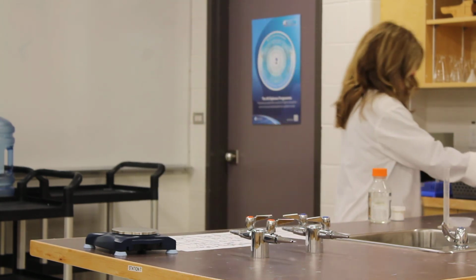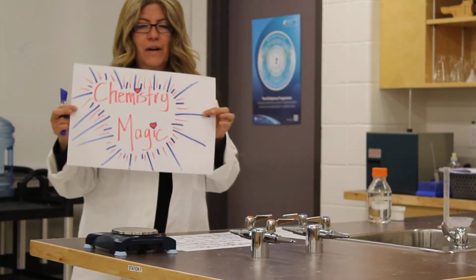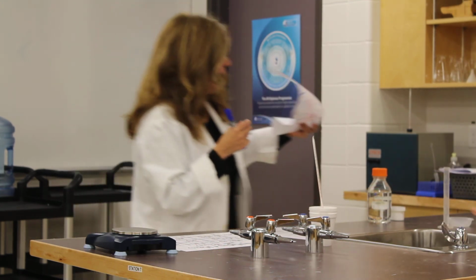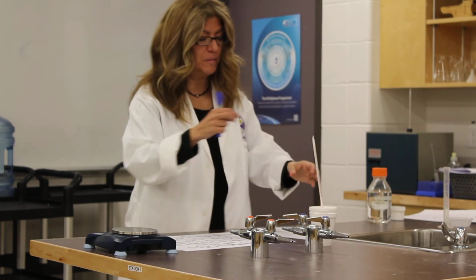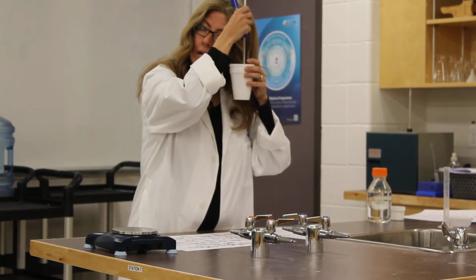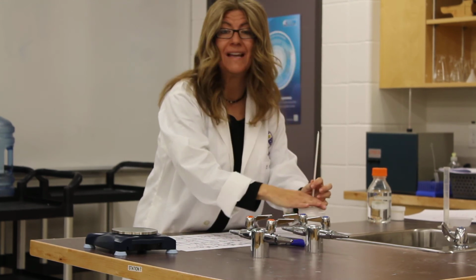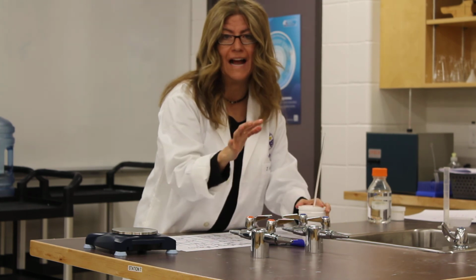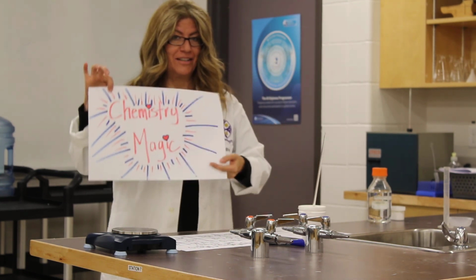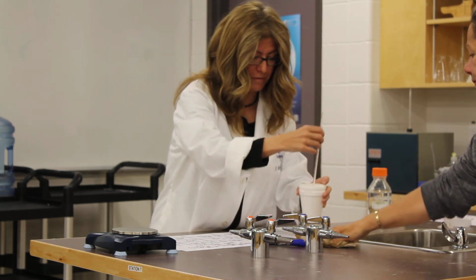Okay, this one's stopping. It's stuck at the same temperature. At some point the magic is over and then we have to just take the data. And wash our hands because we spilled. If we spill we wash our hands. And we have a temperature, 35 degrees. It was pretty consistent there. I don't hear the bubbling. Oh, the magnesium ribbon is gone. It disappeared. It all reacted with the HCl. Chemistry magic happened. So I'm going to take the final temperature, which is 35 degrees Celsius.